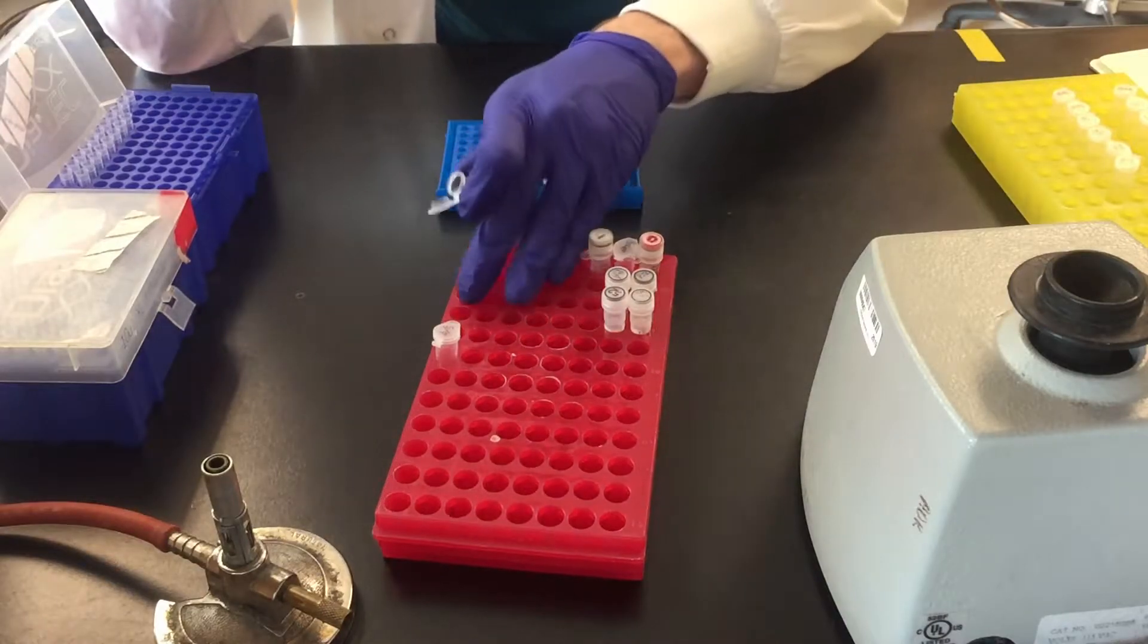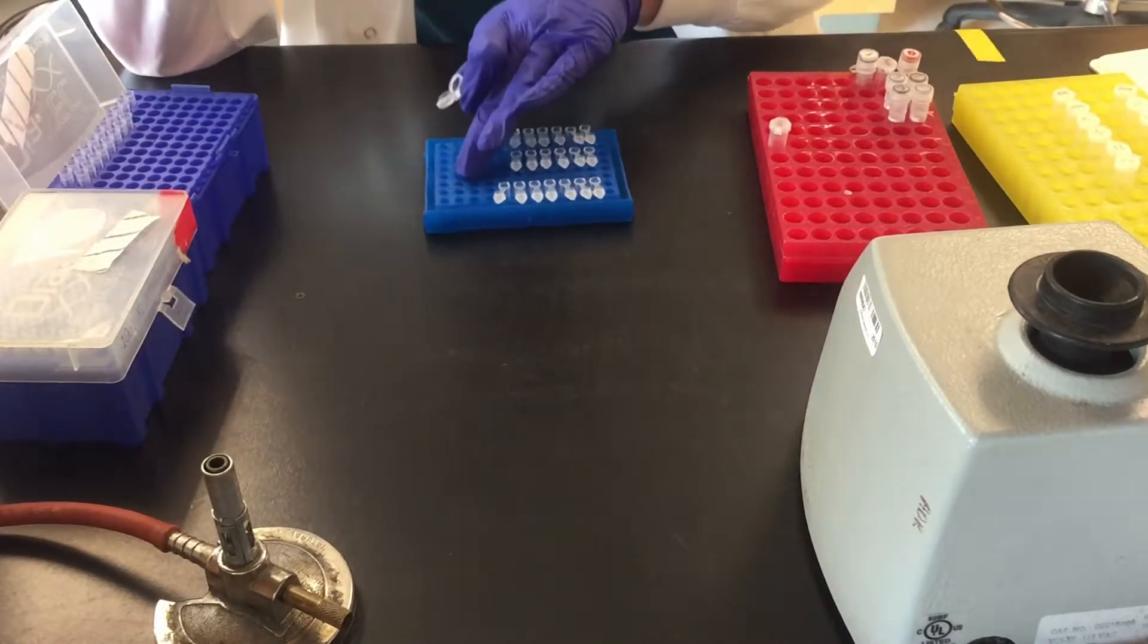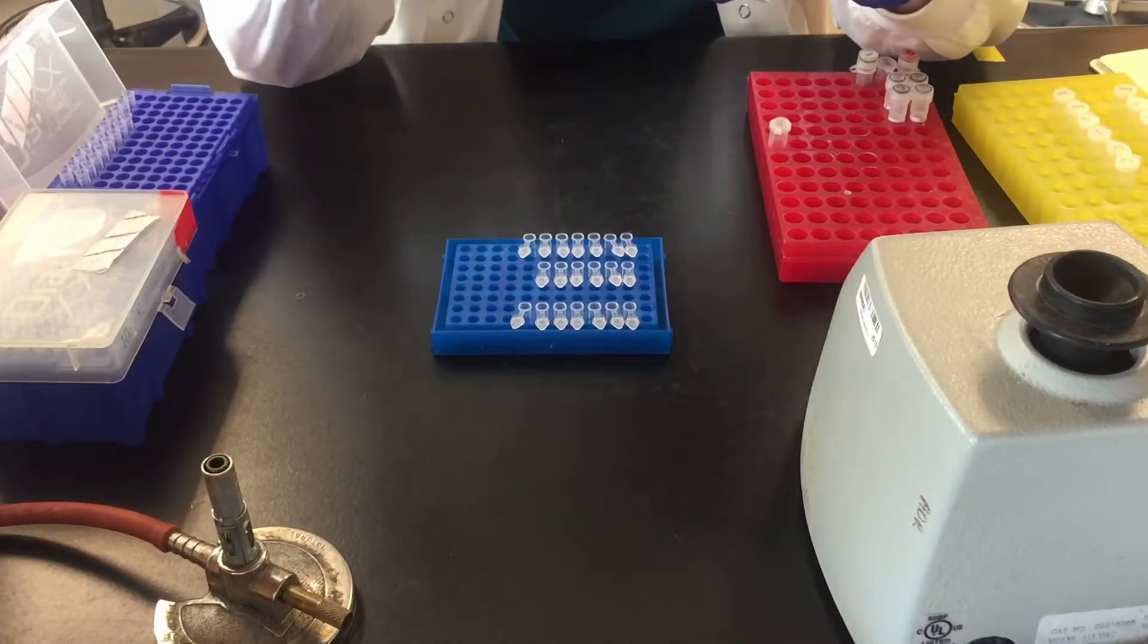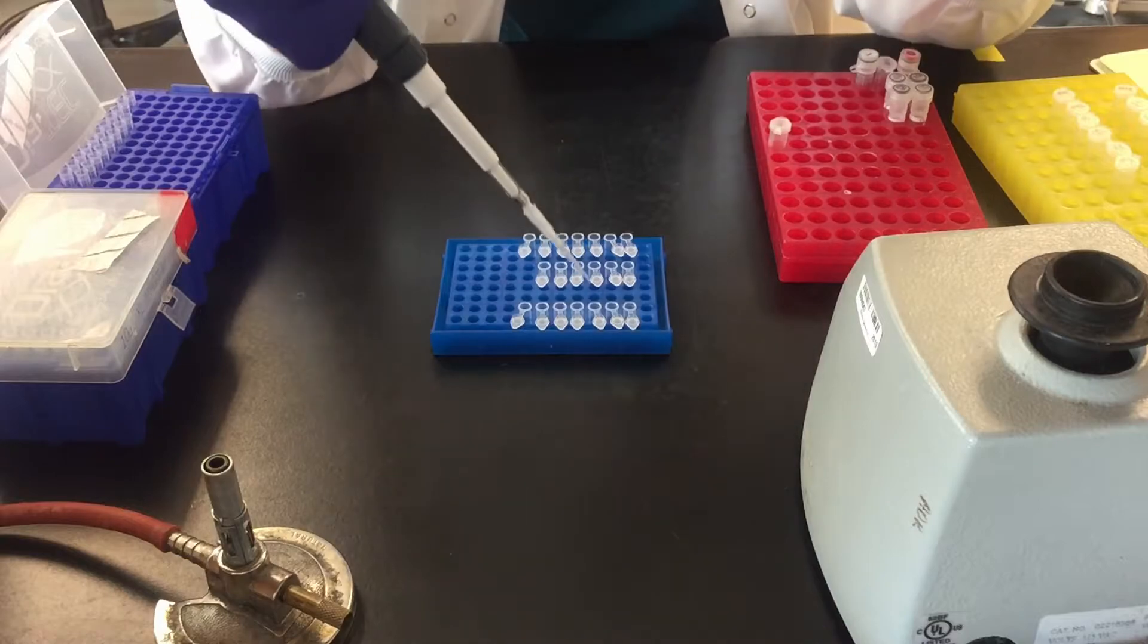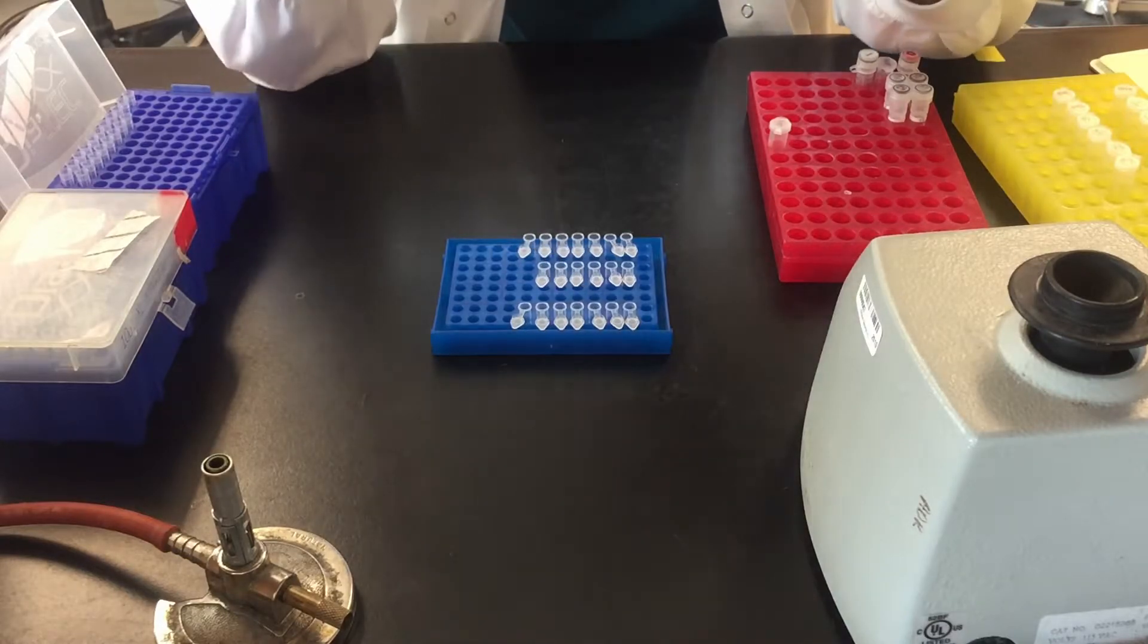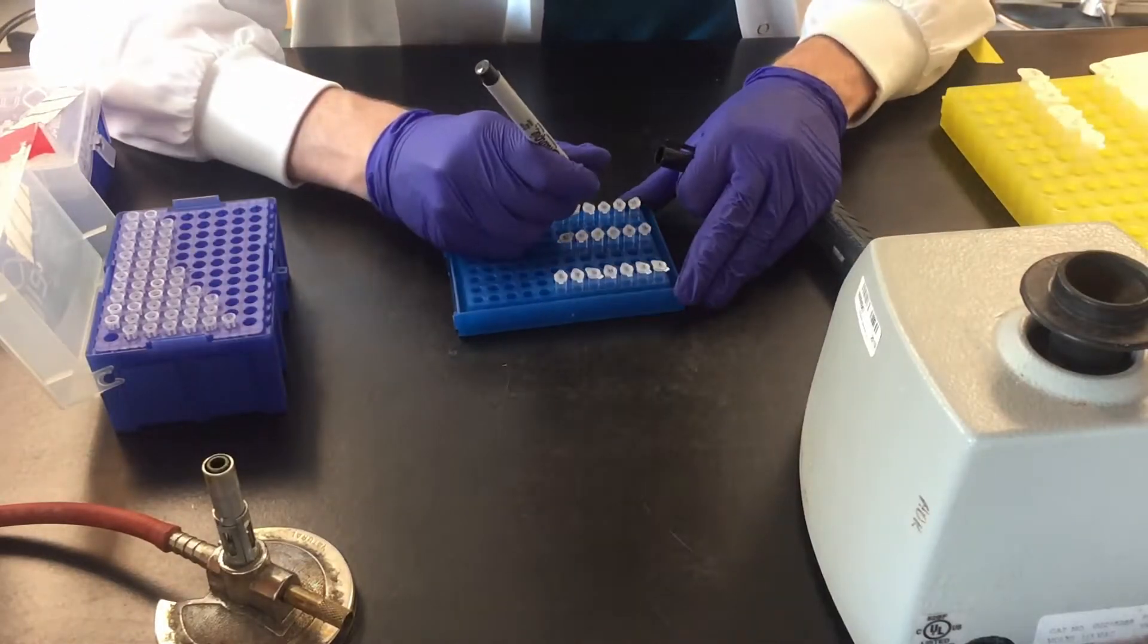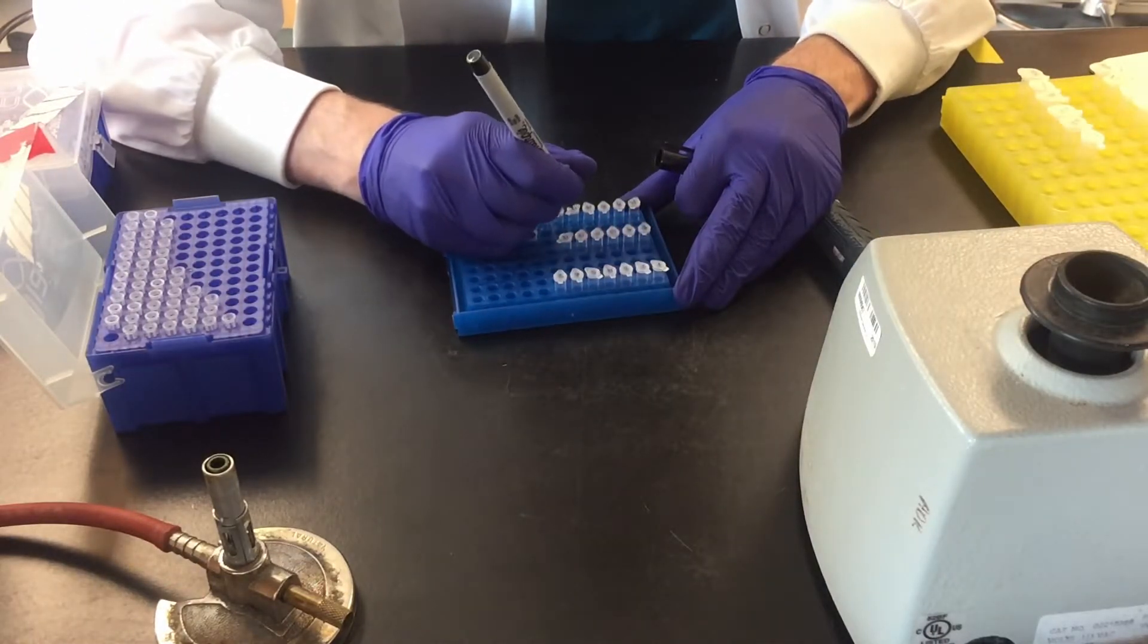I mix again by pipetting before distributing the master mix. In my opinion there's no need to change tips between tubes and you only need to use the first stage of the pipet between additions. As always it's important to label with something distinguishable that you can recognize.